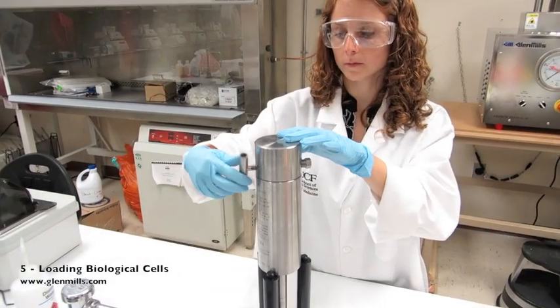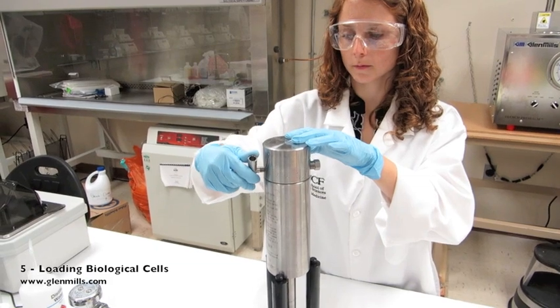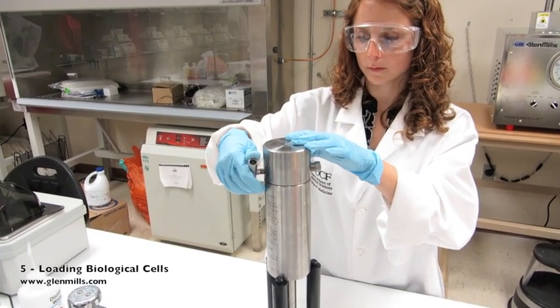Close the flow valve assembly snug, not over-tightened. This is a metal-to-metal seat that can be damaged if jammed in too much.